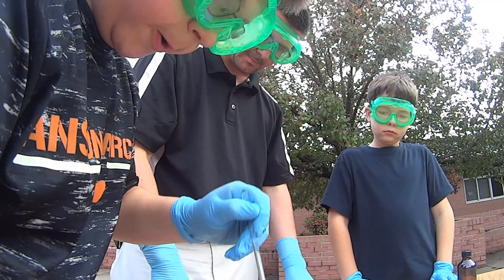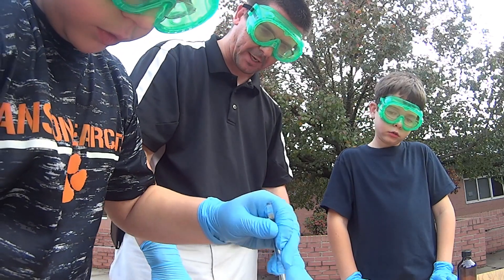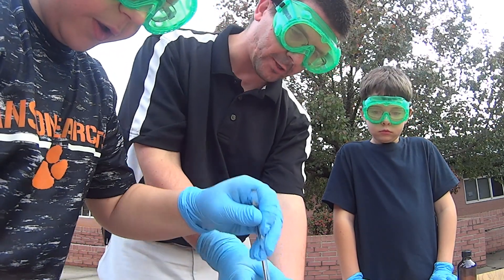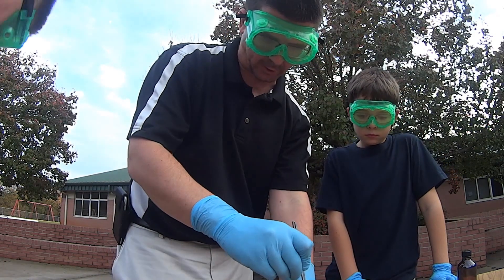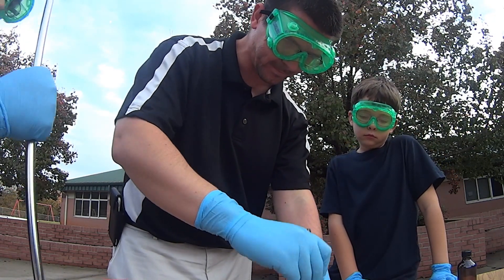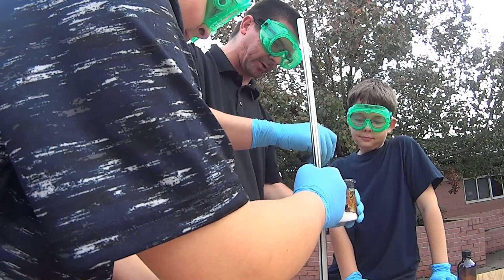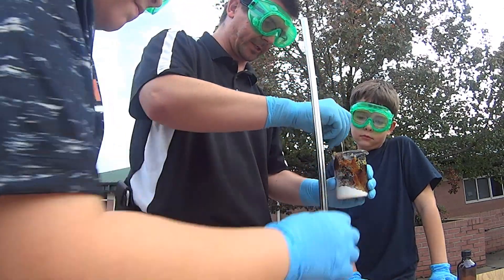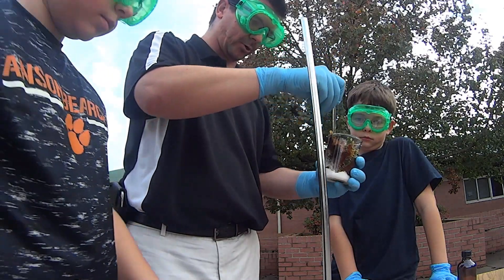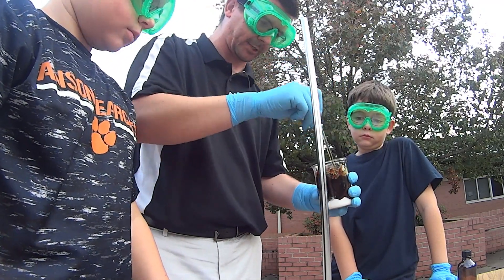It's getting darker. Okay, turning very dark. And do you feel the beaker getting warmer too? It's getting warmer. I'll finish stirring — we're just going to clamp this in so it doesn't fall off. Sometimes they get a little off balance and tip over. It's turning very dark and it's also getting hot because it is an exothermic reaction.